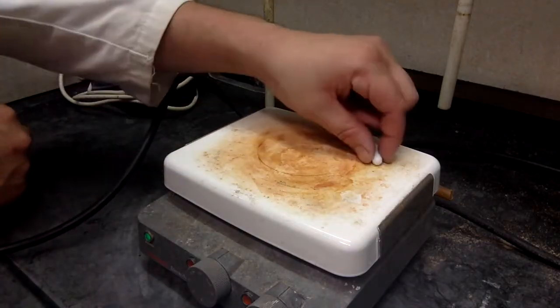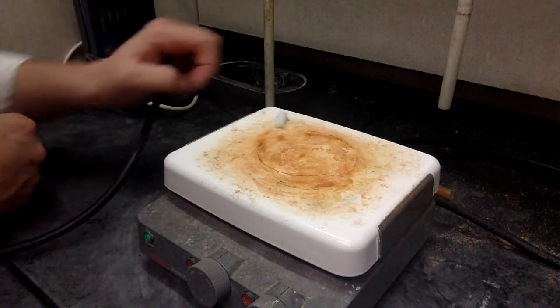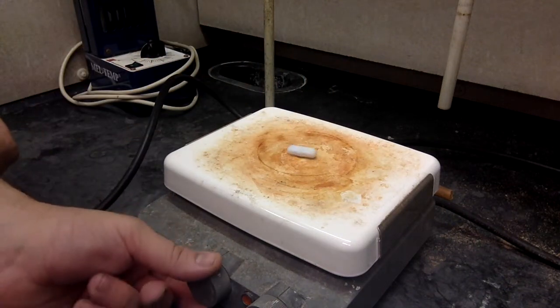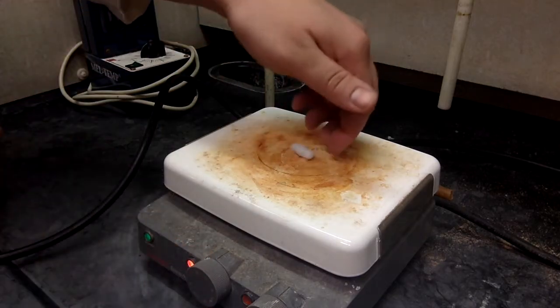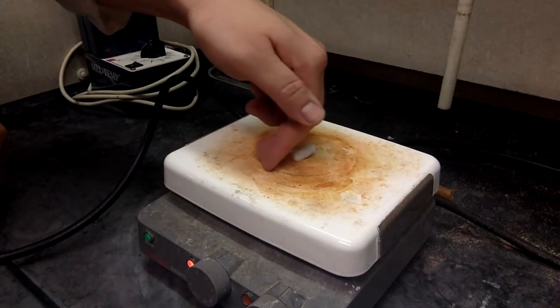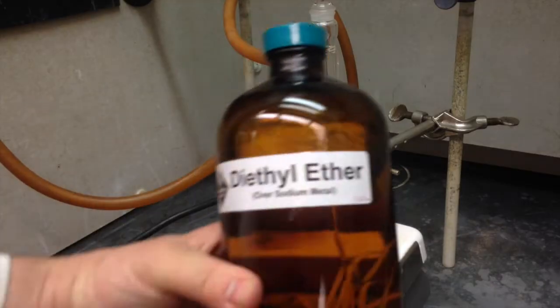When you're working with a stir bar, it works best if you put it in the middle. It wants to be in the middle. That's where the magnet is. So you've got to make sure that you align it left, right, up, down, so that when it's spinning, it's in the middle. Otherwise, it's not going to spin properly. Look at this one when I push it out of form. It just wants to jump back. Back to the apparatus.